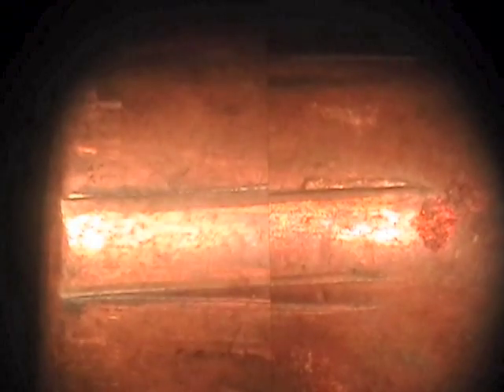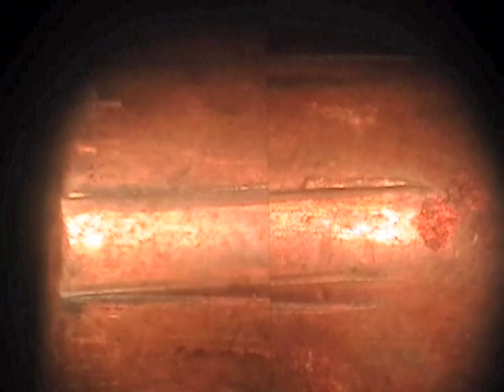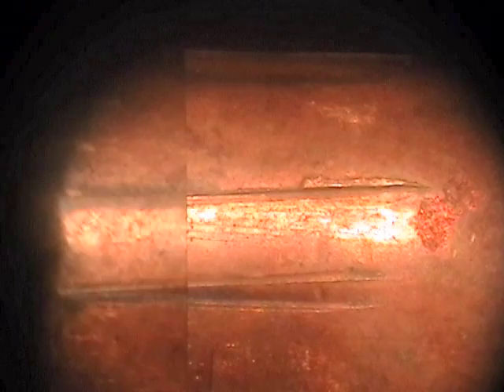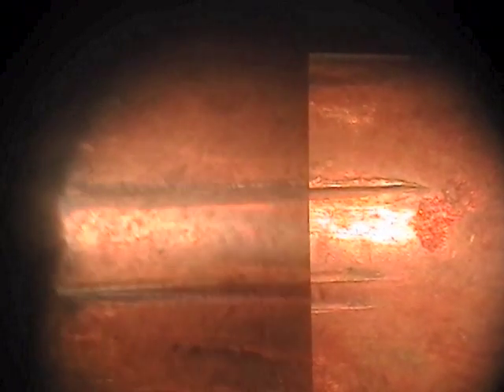This is the two bullets underneath the comparison microscope. The bullet on the left side is shown on the left side, and the bullet on the right side is shown on the right side. If we move the split screen here, we can see more of the right bullet, which lines up with the left side. And moving it back towards the right, we can see more of the left bullet matching up with the right bullet.